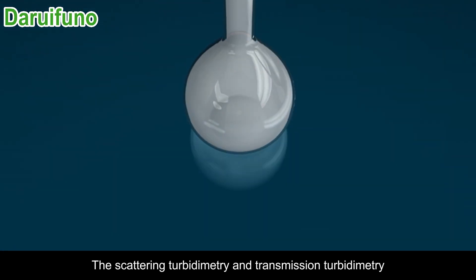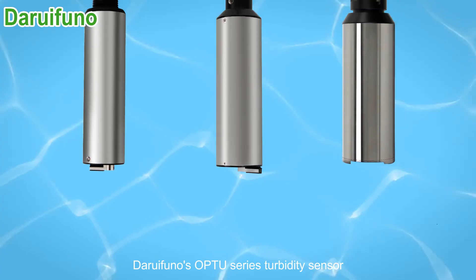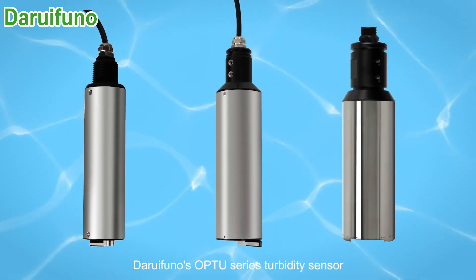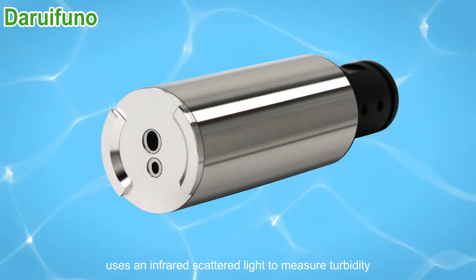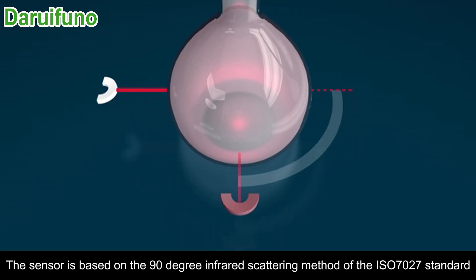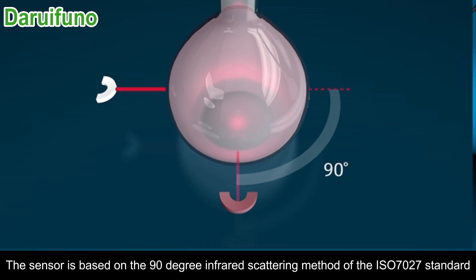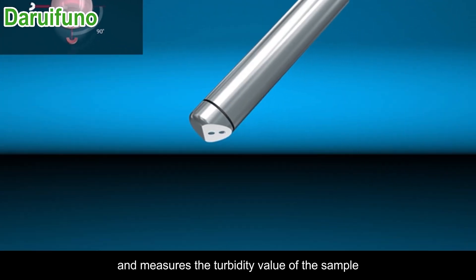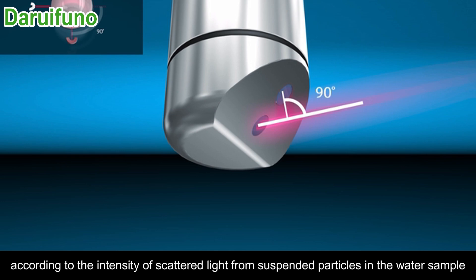Scattering turbidimetry and transmission turbidimetry are the two most widely used methods. Daruifuno's OPTU series turbidity sensor uses infrared scattered light to measure turbidity. The sensor is based on the 90-degree infrared scattering method of the ISO 7027 standard and measures the turbidity value of the sample according to the intensity of scattered light from suspended particles in the water sample.